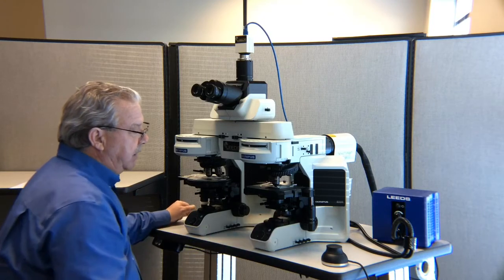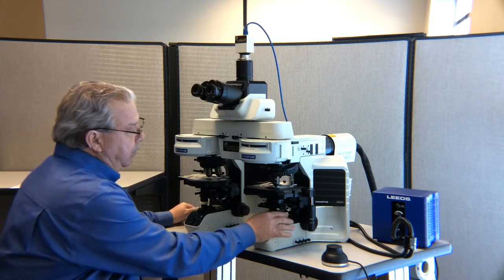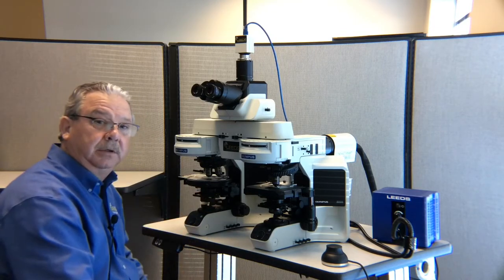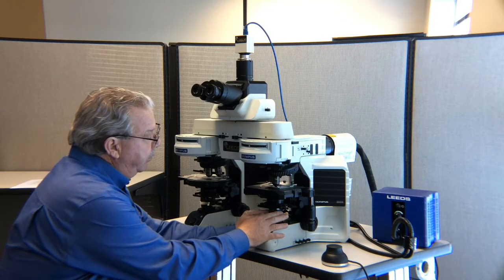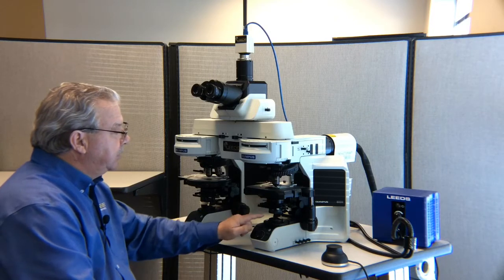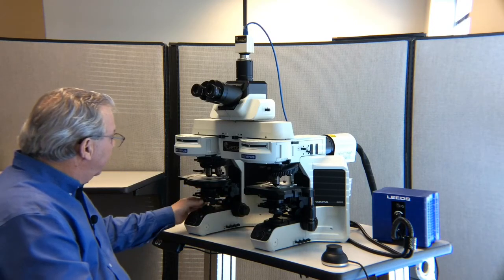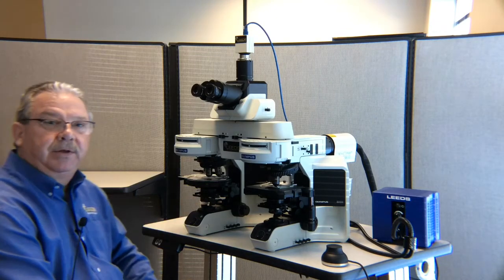This is a special option that Leeds makes. Olympus leaves this polarizer permanently mounted if you don't have the Leeds option. If that's the case, we're going to want to make sure that both polarizers are oriented in the same direction. So if you can't remove your polarizer from the ray path, you're going to set the right and the left polarizer both at 0.